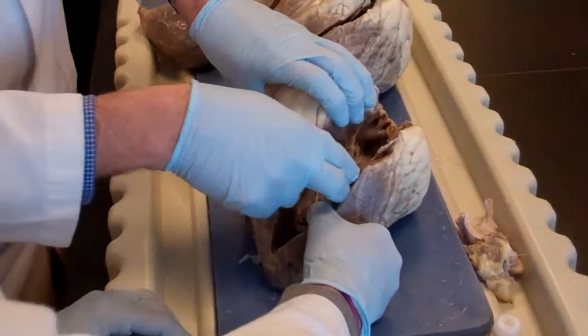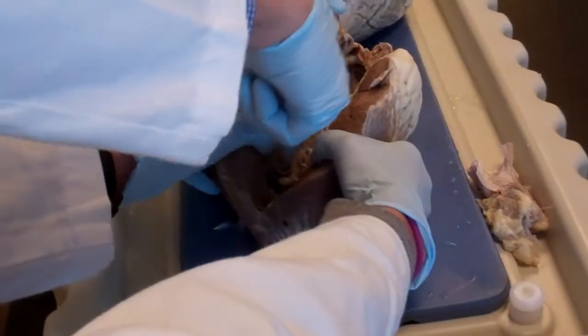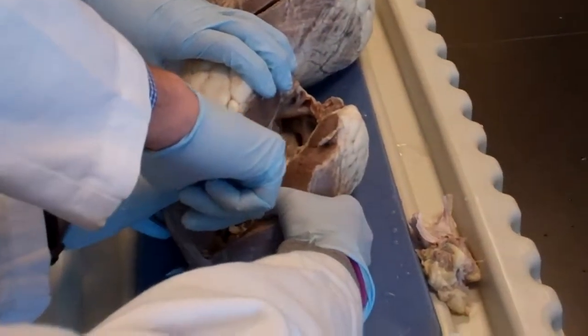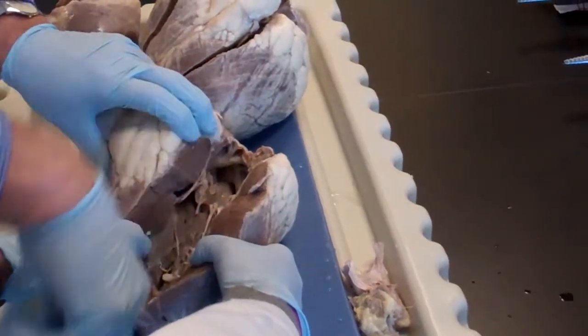I'm going to confirm it more. Leave it open, please. Hold it open. Okay. Now you can see very clearly. Hey, 2 hands. Didn't I ask that you have good muscles? Papillary muscle. This is an outbudding of the muscles, coming from the other side. And you have the chordae tendineae coming out of it.